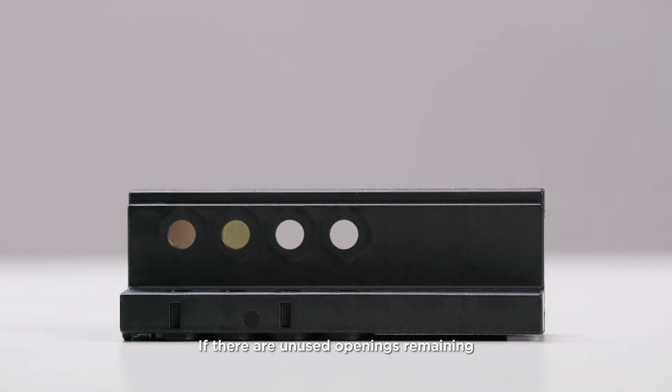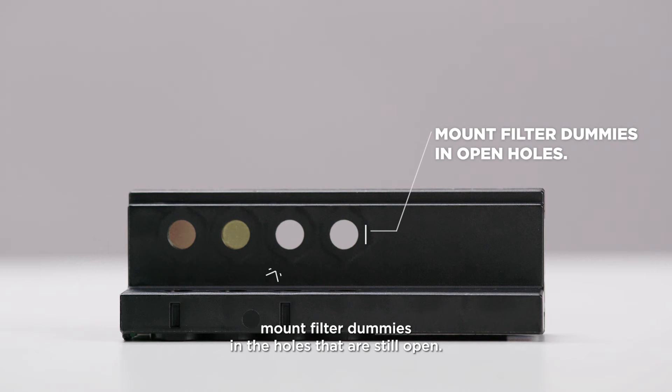If there are unused openings remaining after the required filters have been inserted, mount filter dummies in the holes that are still open.